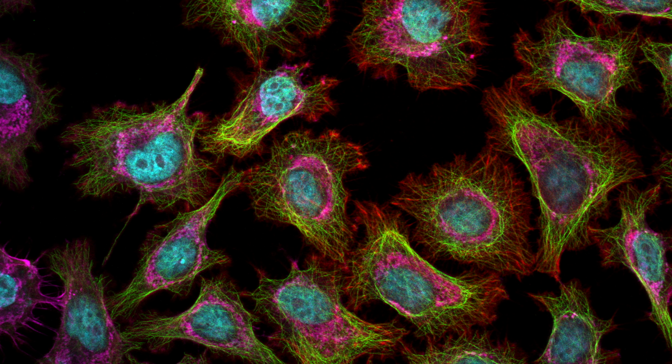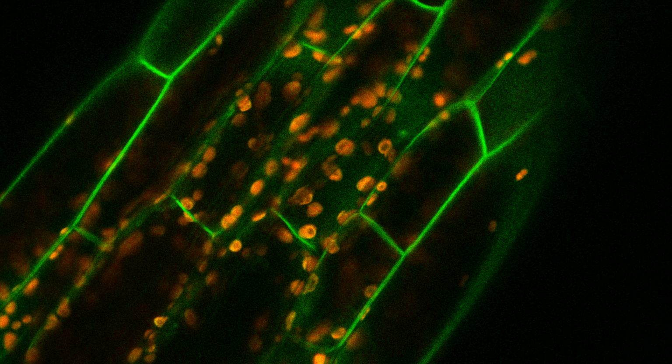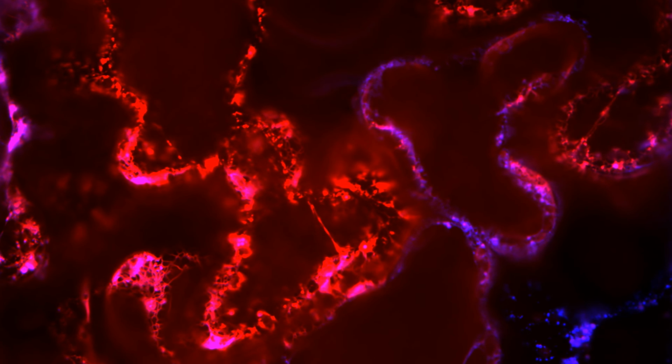As bioimaging has always been a strong aspect of research at BOKU, we would like to show you how amazing imaging projects can be. The range of samples that can be visualized with our microscope is quite broad. Bacteria, yeast cells, cell cultures, tissue slices, isolated organelles, plants or parts thereof, artificial materials, worms, early-stage embryos, and many, many more. We will show you 3 different projects that benefited from the new microscope and hope to be able to share our excitement about the new possibilities for conducting research with it.